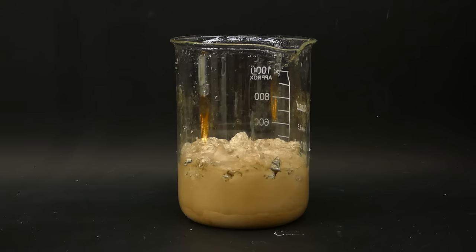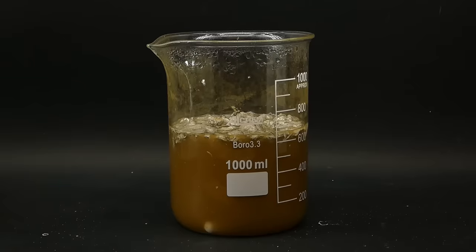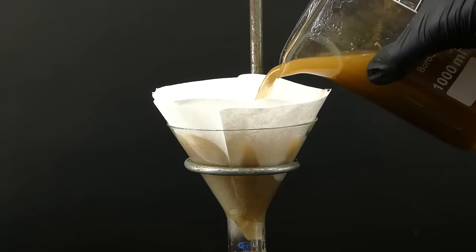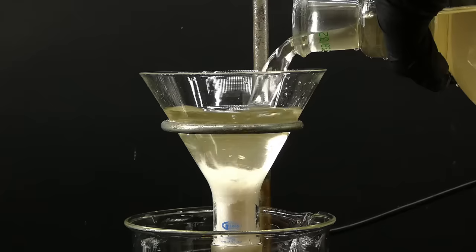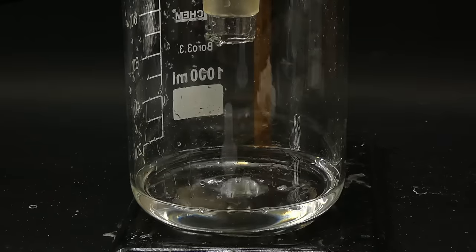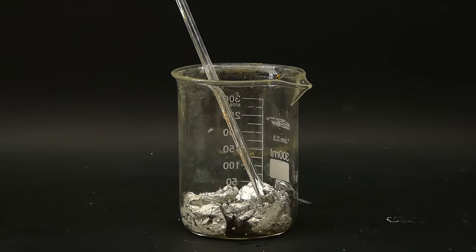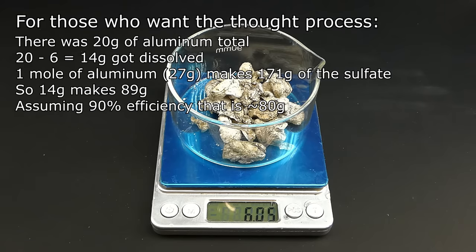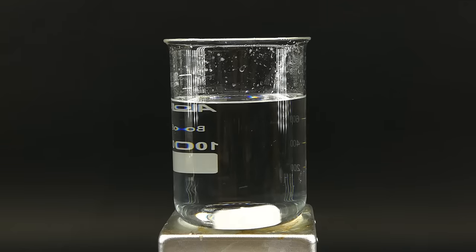And when I came back it all turned into this weird brown brick of hydrated aluminum sulfate and unreacted aluminum foil. To start processing this thing I added some distilled water and heated up everything on a hot plate to dissolve it. Now to remove the undissolved foil along with this weird brown impurity I passed this solution twice through a double layer of coffee filters, which took forever. After all this it still didn't look too great so I passed it through a tightly packed piece of cotton, which did the job much better but took 5 hours.